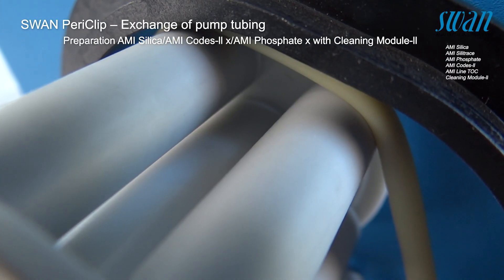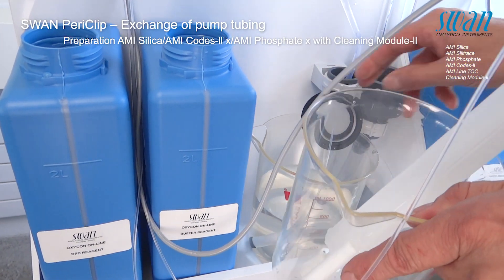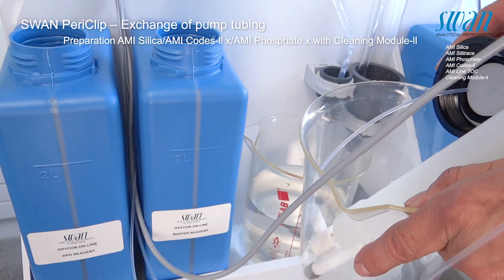After the pump has stopped, place the suction lances in an empty bucket and repeat fill system to empty the tubes.